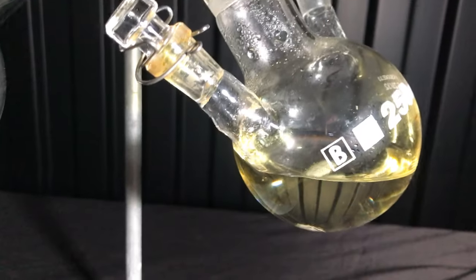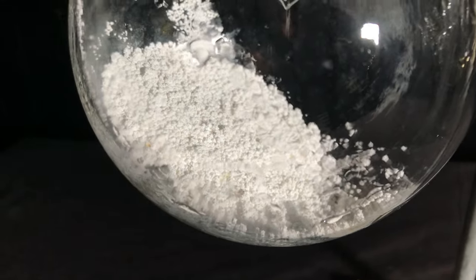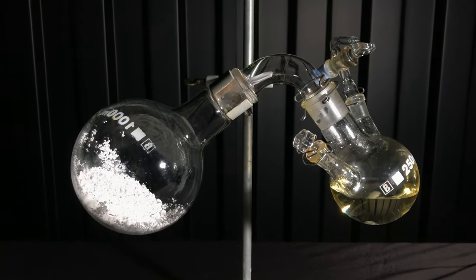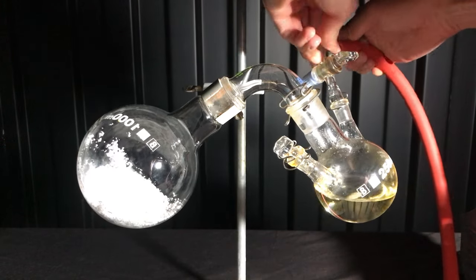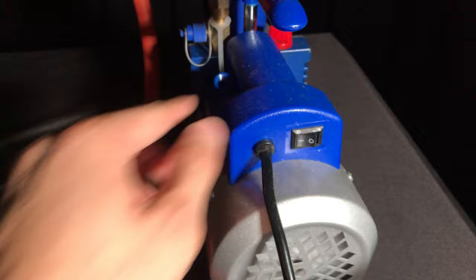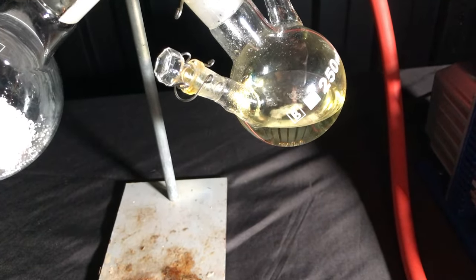To get a dry product you could boil down the solution on a hot plate, but this is a surefire way to get a lot of tiny carcinogenic droplets which you would inhale. A better way is to either use an expensive rotary evaporator which I don't have or to connect your flask to a second one containing anhydrous calcium chloride to evacuate the apparatus and to apply heat to the reagent containing flask.